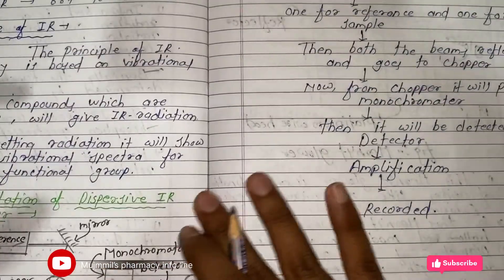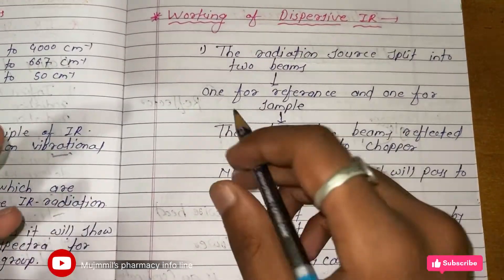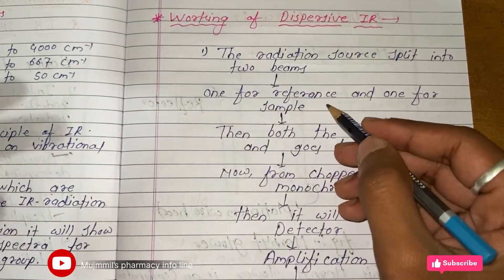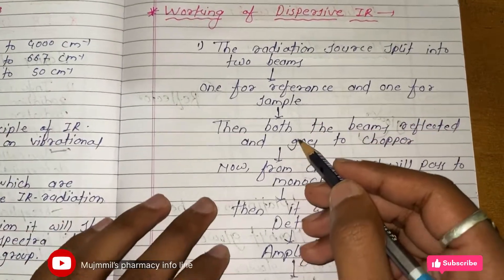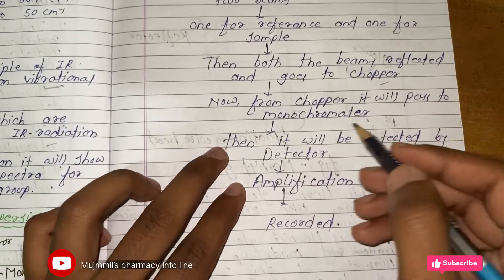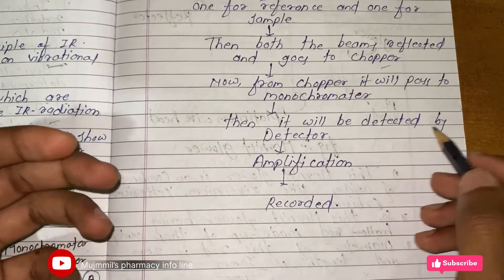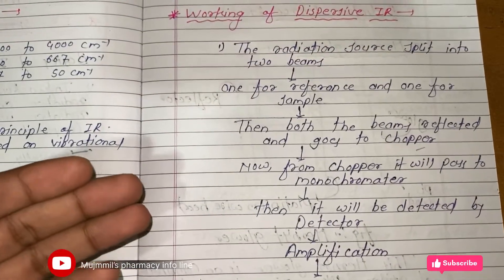Let's see the working of dispersive IR. The radiation source splits into two beams — one for reference and one for sample. Both beams are reflected and go to the chopper, then pass to the monochromator, then are detected by the detector, followed by amplification and recording. This is the simple working of dispersive IR.